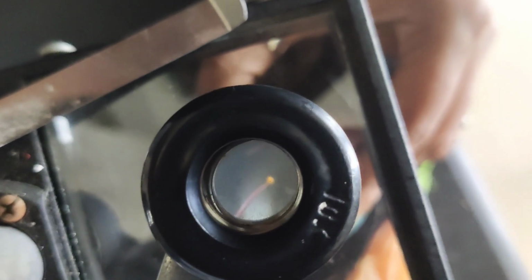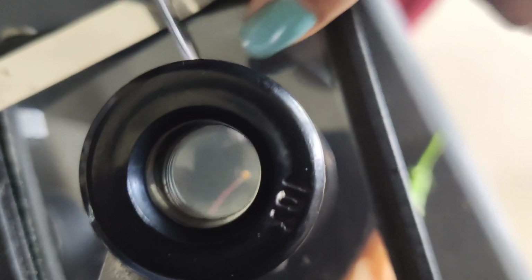Even if I try to just observe the small anther, if I separate it with the help of the needle, see, can you see this? I'm just trying to work on this, and this you cannot do in the compound microscope, because here I'm easily working on the stage. This is giving me a working distance. In a 3D process, I'll be able to work with any specimen that I'm gonna keep here. You can see this anther and the stamen. But if you see it with your naked eye, this is going to be very minute and difficult for you to observe it. So that's the beauty of this dissecting microscope.